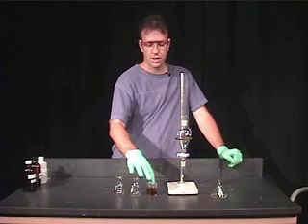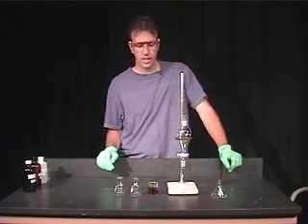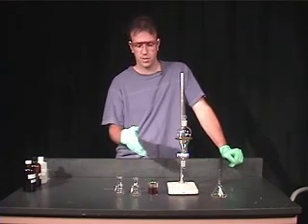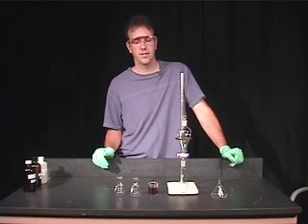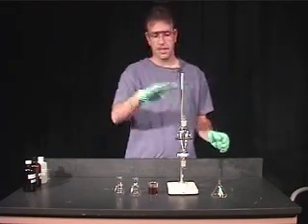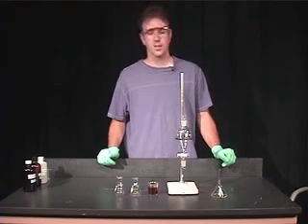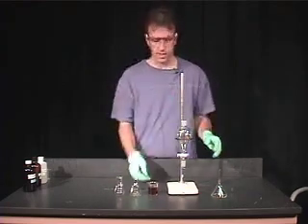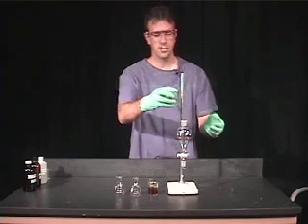I have a solution here, this brown solution, that contains caffeine — it's basically an extraction from tea. I'm going to add that to my separatory funnel. To make that easier, I'm going to use a funnel.